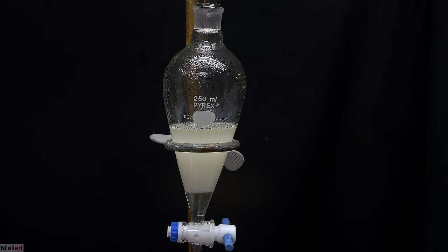At the end of the distillation, you can see here the incredible yield of product that I got. I transferred all of the product to a small amber glass vial, and the total weight came out to be about 0.5 grams. This corresponds to an incredible yield of about 2%. To make matters even better, this is a crude yield, and it probably only is 50% 1-octen-3-ol.